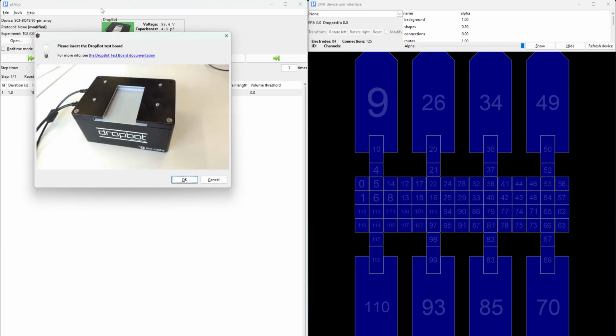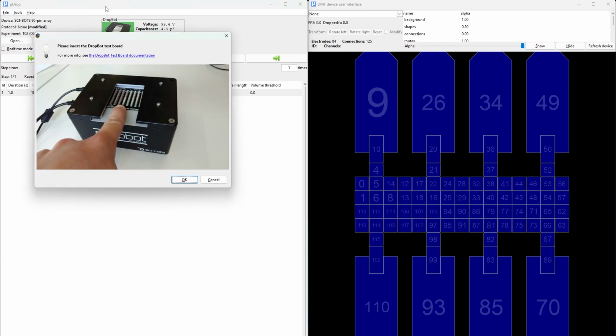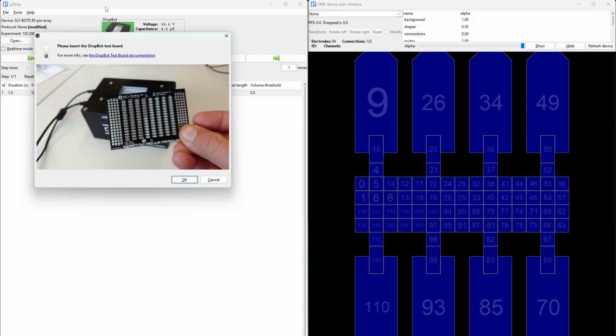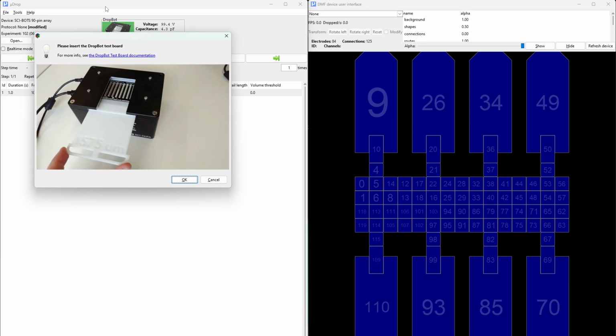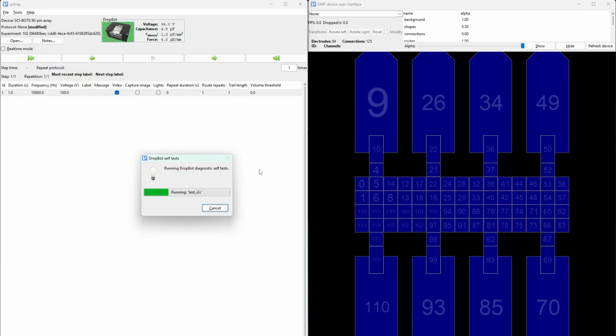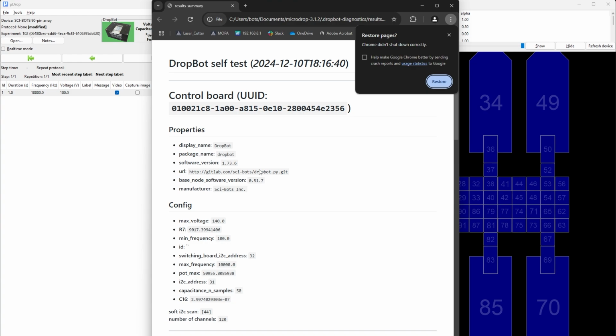A pop-up window will now prompt you to insert the DropBot test board into your DropBot. Make sure it is fully inserted into the chip holder. Once it is secured in place, click OK to continue. MicroDrop will now begin running each diagnostic test sequence. You will see a progress bar as the tests are being executed. This process may take a few moments. Once complete, your internet browser will open a new window displaying the test results.